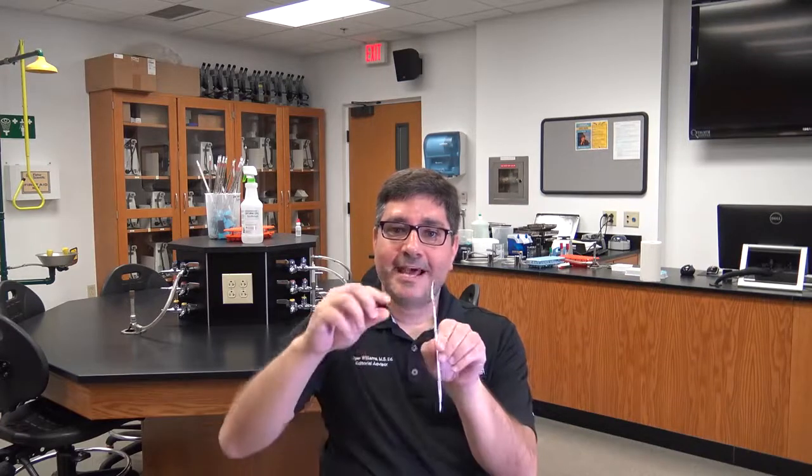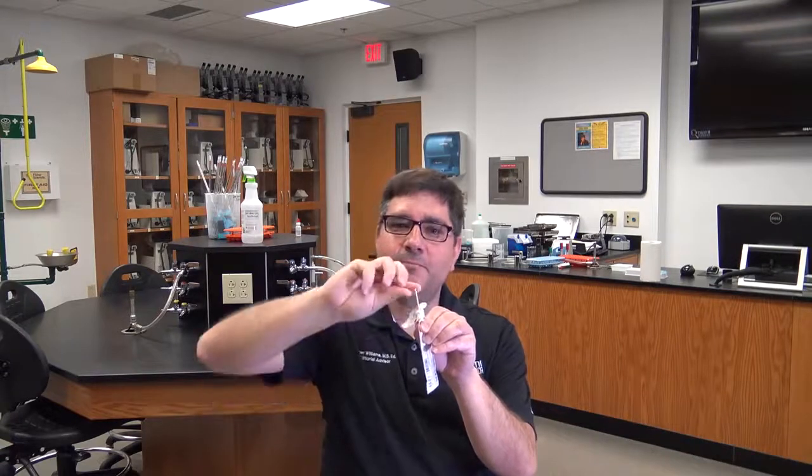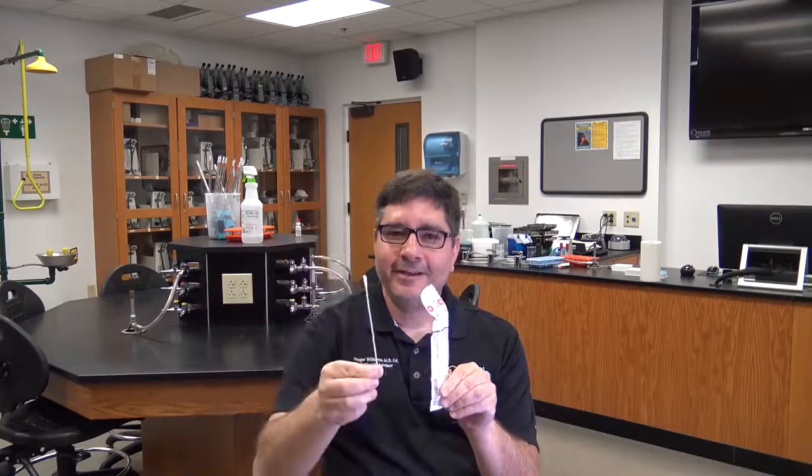Today, you and your partner will be conducting a nasal and throat swab on 2 separate plates. Divide your plates in half and you will streak using a cotton tip applicator your nose on one side of the plate. To open the swab, grab the side that has no cotton and simply pull down on the paper wrapping and remove the applicator. You can obtain your nasal sample yourself and should place the swab into your nose until you feel slight discomfort, but nothing more. We don't want you to damage those precious brains.